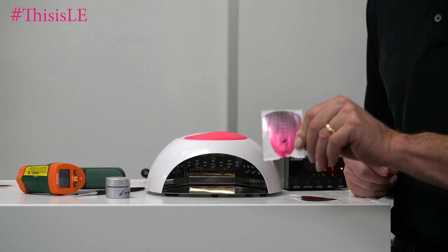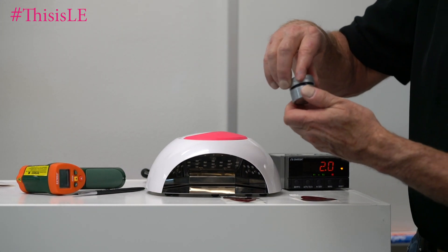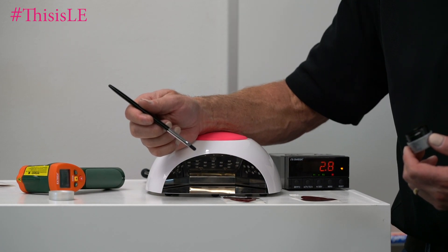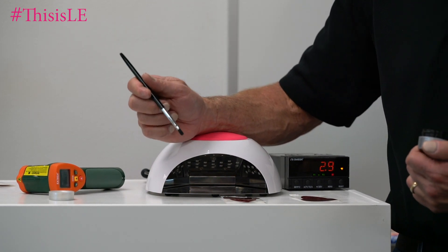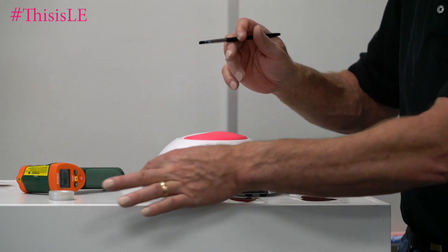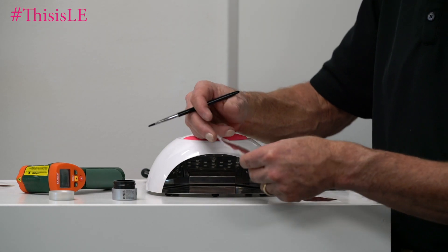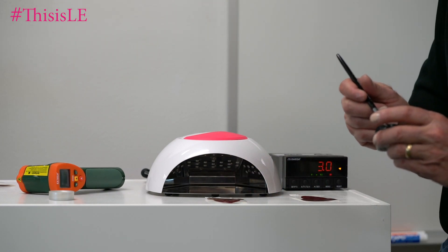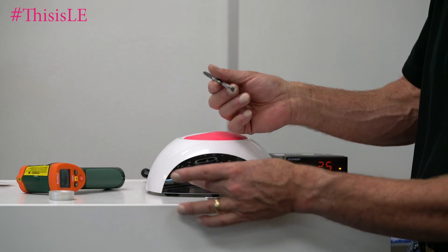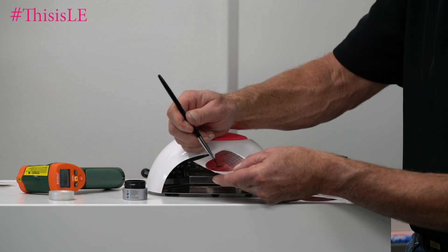What we'll do is we'll actually use a regular nail form. In this case here, we're looking at our extreme gel. When we do our testing in the QC lab, we measure the exothermic reaction of every batch of gel that we make. We use 0.25 grams of gel, put in the little circle that normally pops out of the form. Since I don't have a scale here, I'm going to take a little bit of gel out of the container and put it on the form.